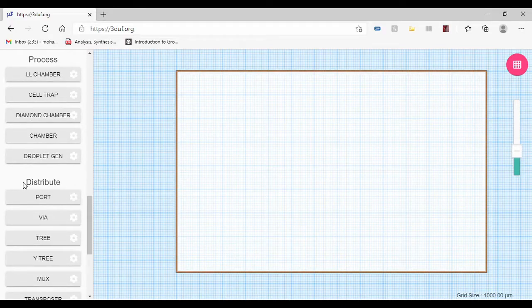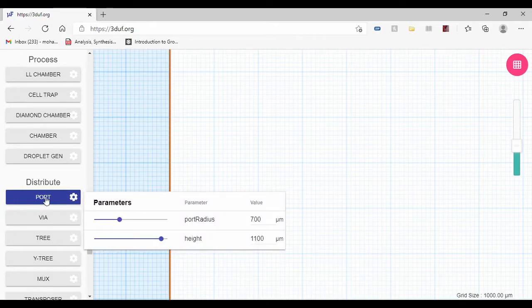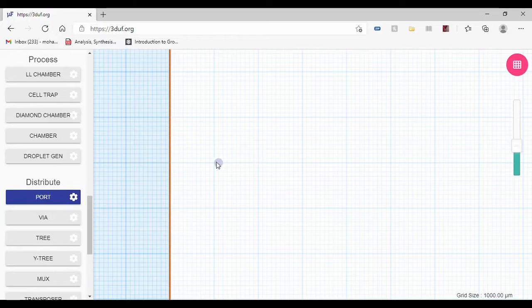The first thing I'm going to do is design a simple microfluid chip. And the first thing I'm going to start with is adding a port. A port is basically where all your fluid is going to be collected. So I can press here to change the parameters for my port. Let's say I have a 1000 micrometer port. I'm going to put it right here.